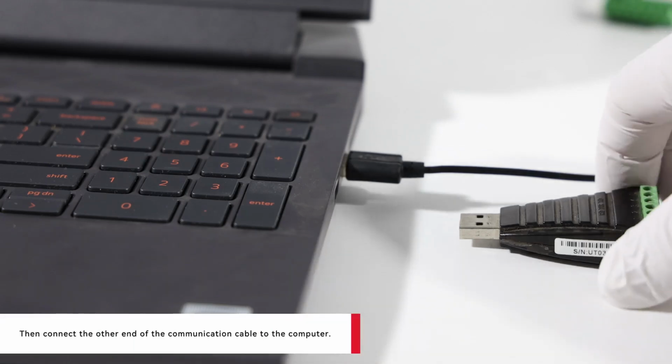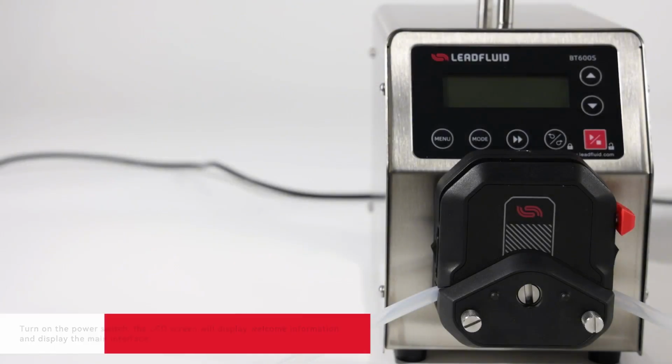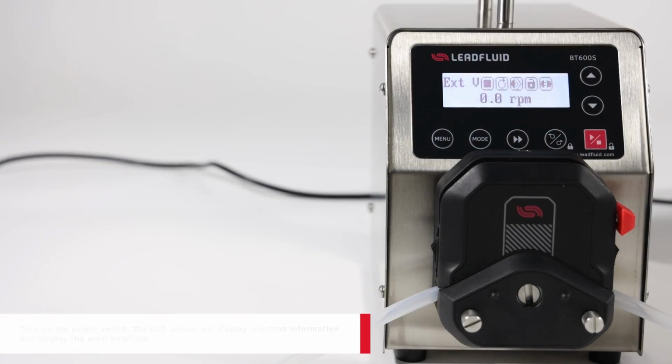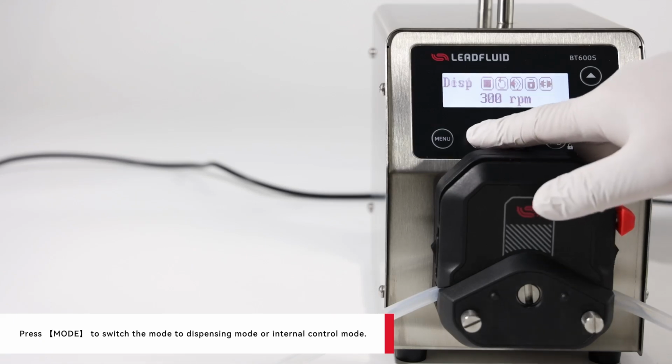Then connect the other end of the communication cable to the computer. Turn on the power switch. The LCD screen will display welcome information and display the main interface. Press mode to switch the mode to dispensing mode or internal control mode.